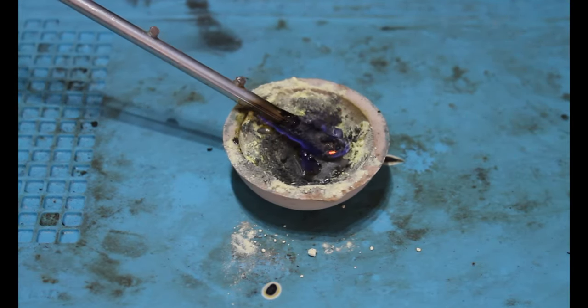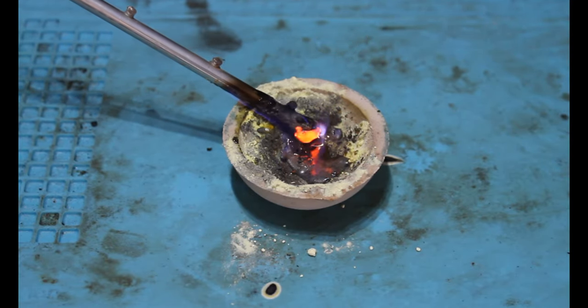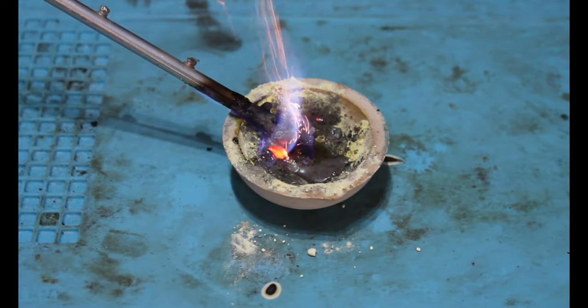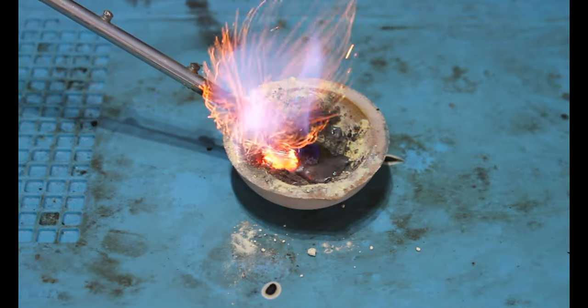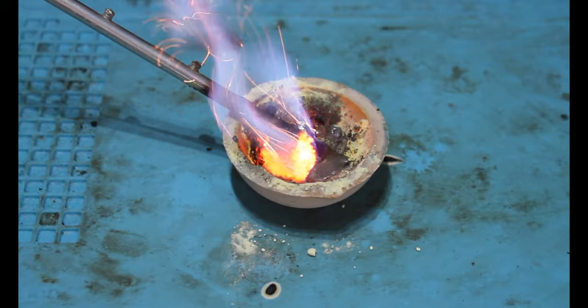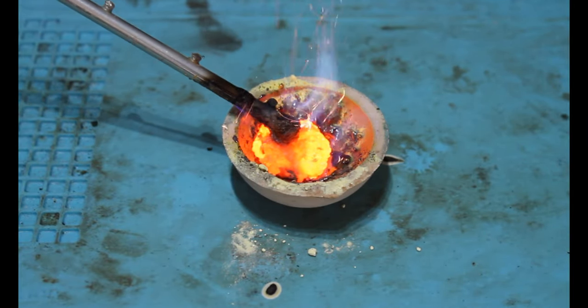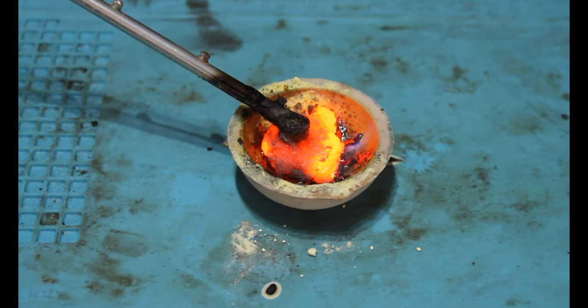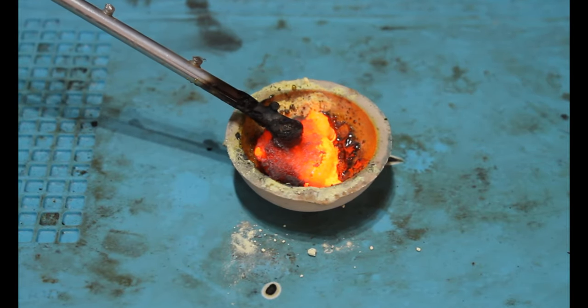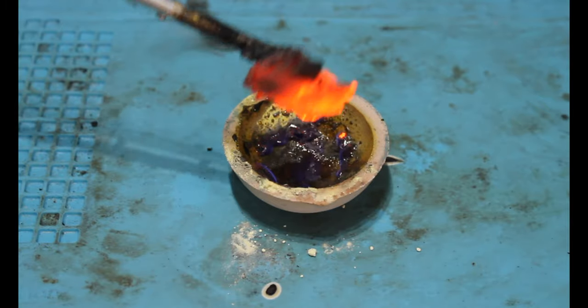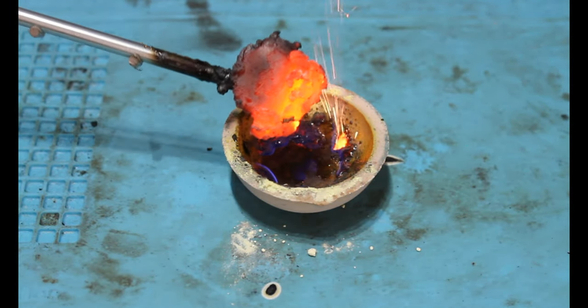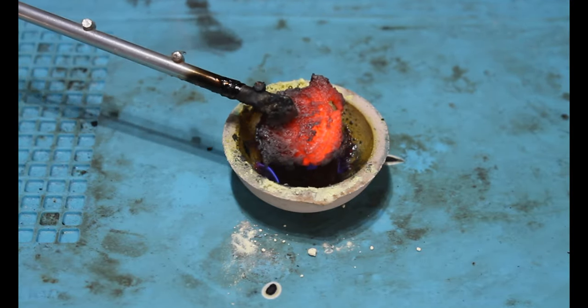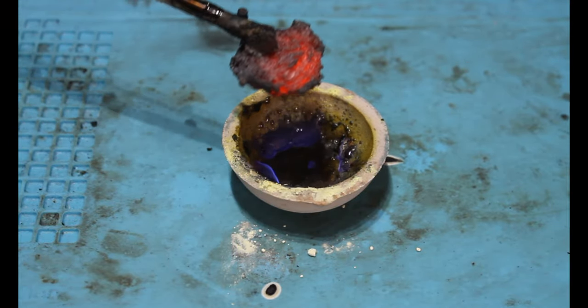After about two minutes we see the entire mixture begin to combust with sparks of iron shooting out and a glowing compound of iron and sulfur forming at the very tip of this steel rod.